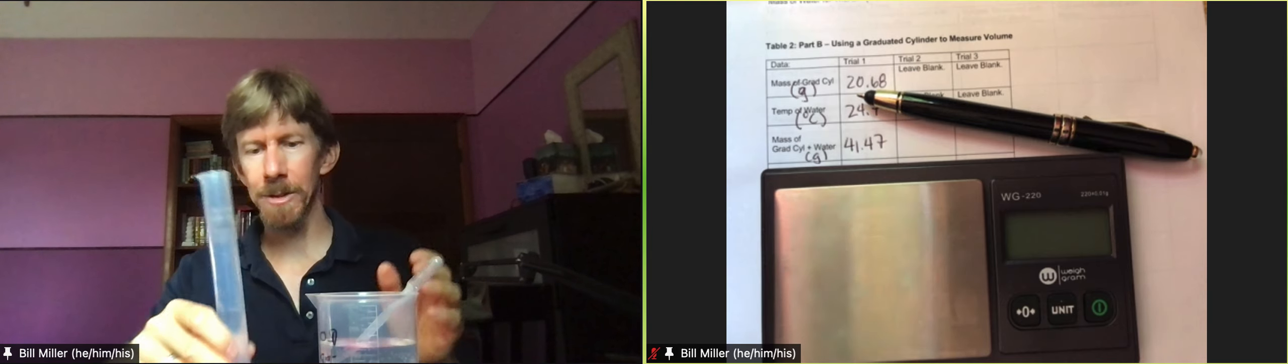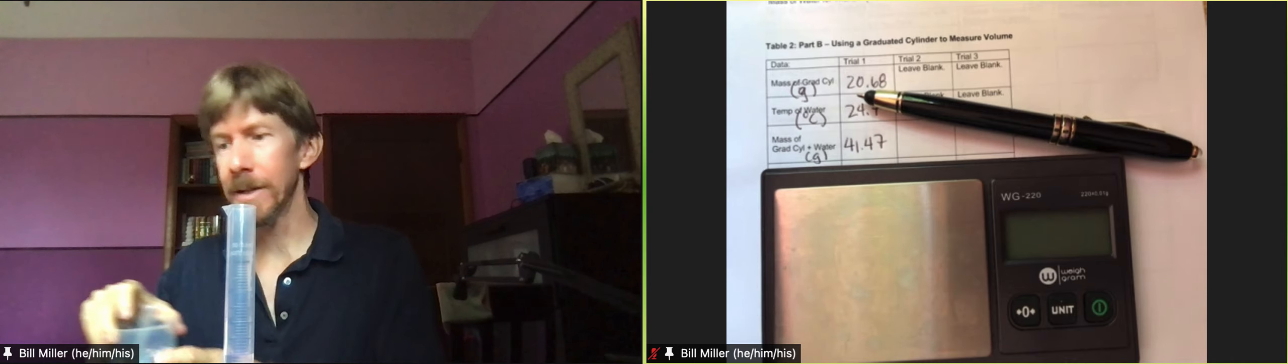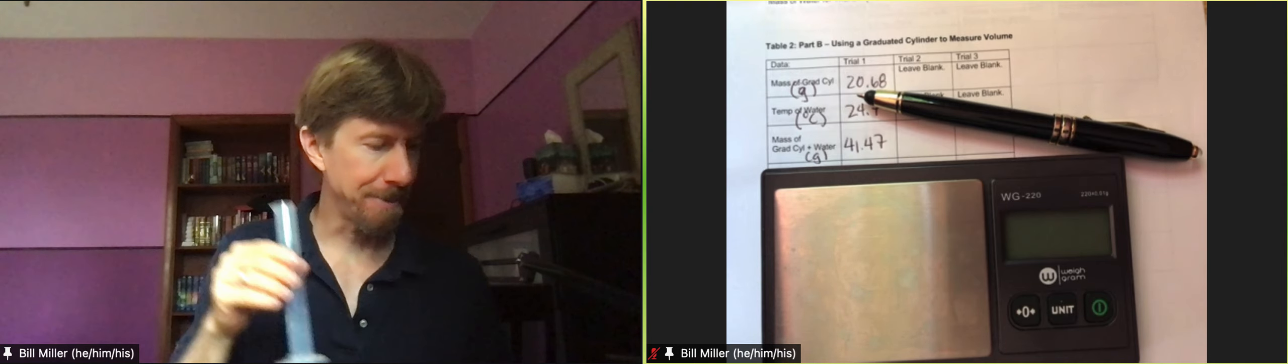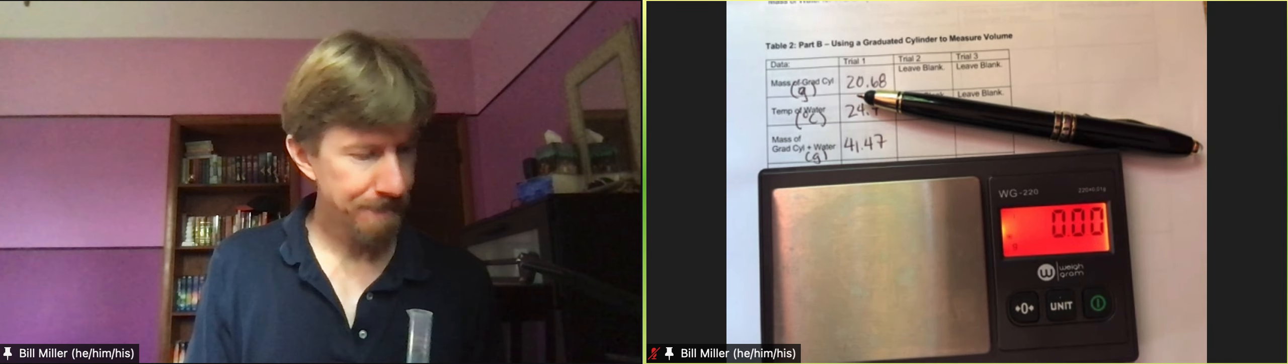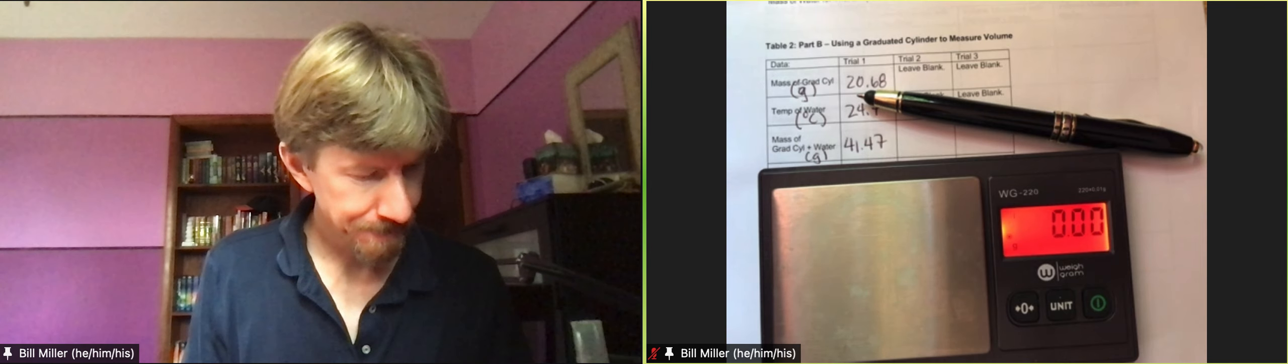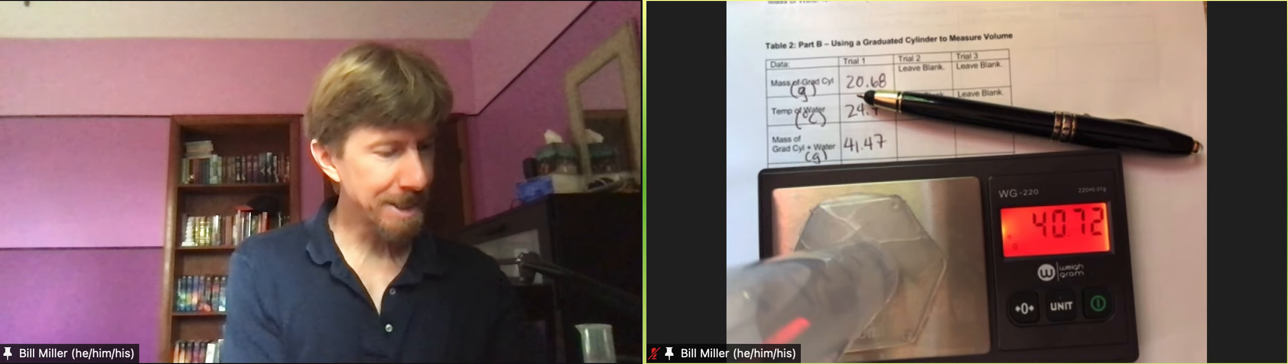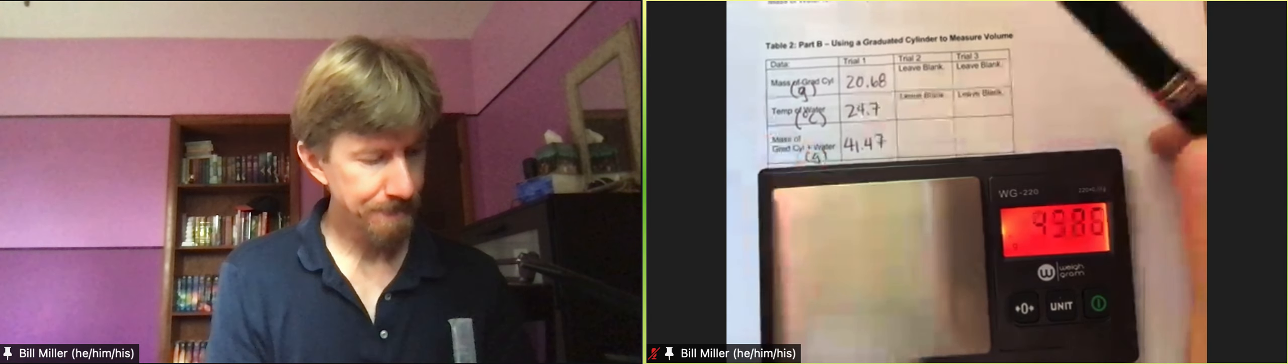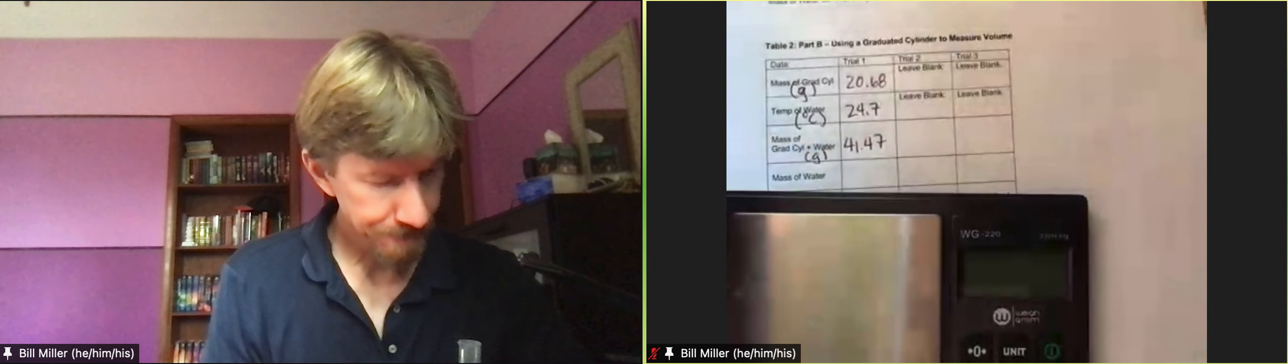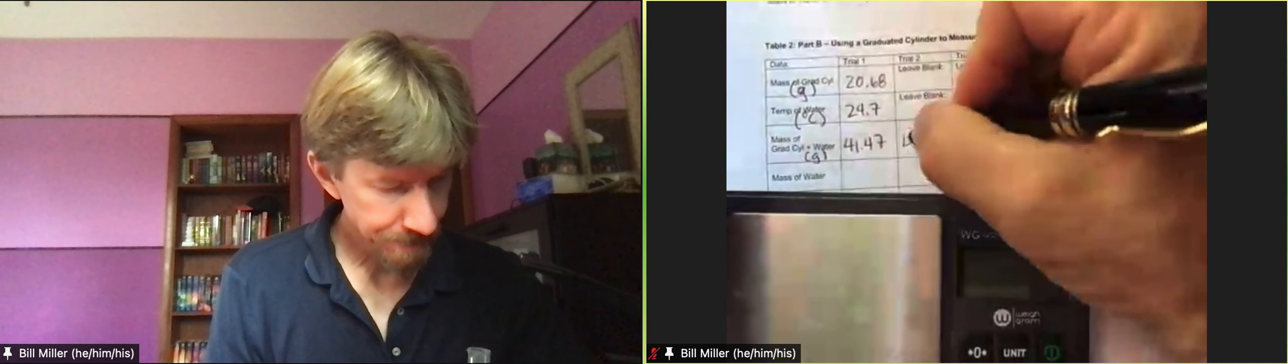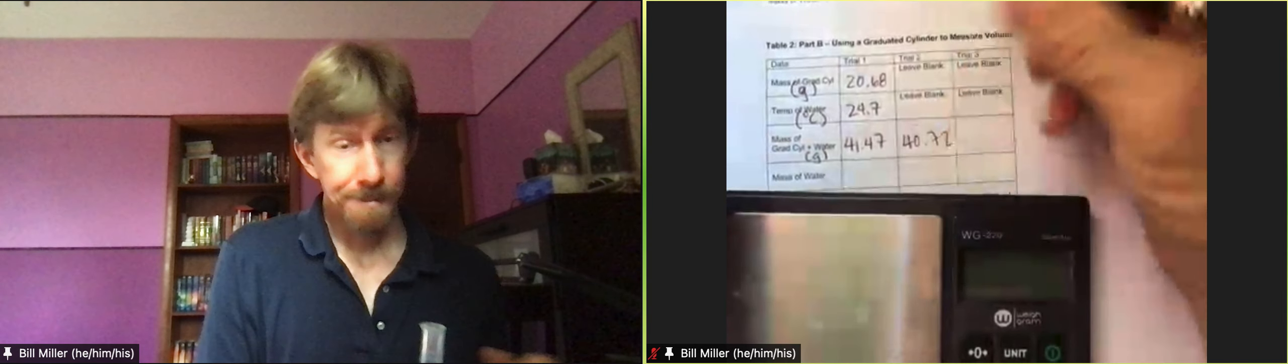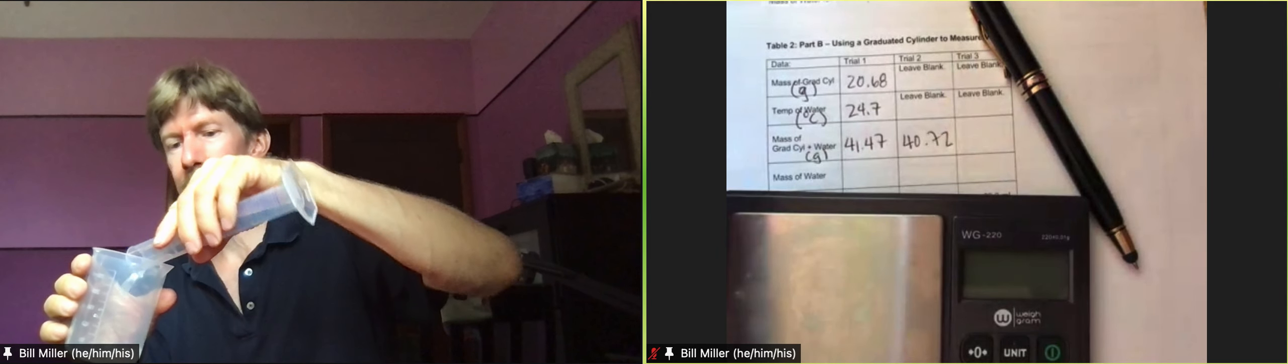That looks like my 20, and you're probably going to get a different value because you're just estimating it. There's my dot: 40.72. Okay, that's fine.